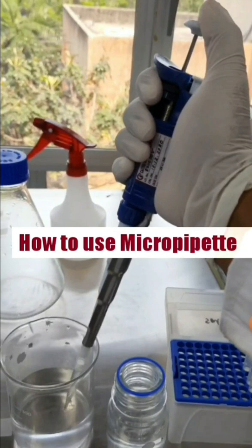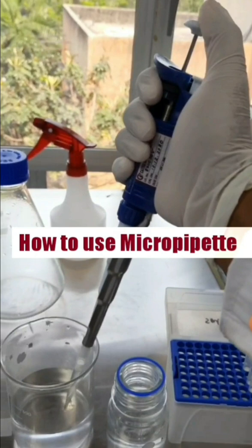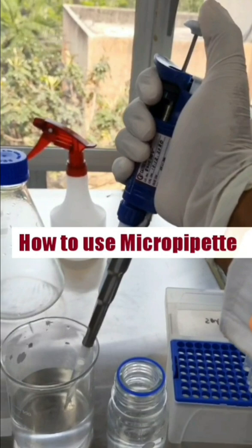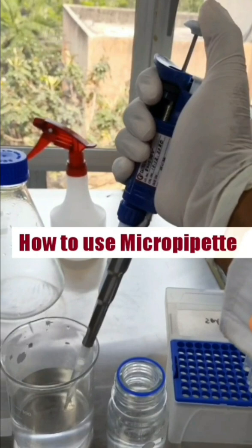Hello friends, today in this video we are going to show you how to use a micropipette — specifically the 1000 microliter or 1 ml micropipette. First we will show how to adjust the volume, meaning what amount of volume we want to transfer, and then we will show how to transfer the exact amount of volume from one container to another.